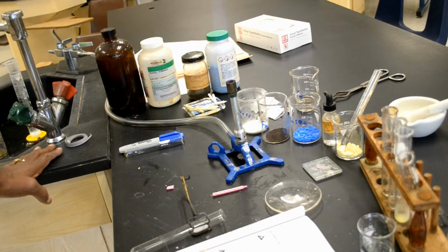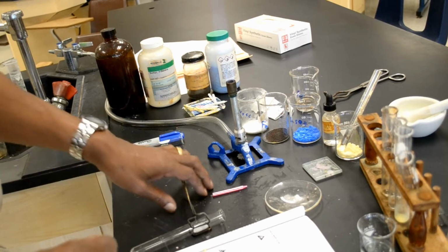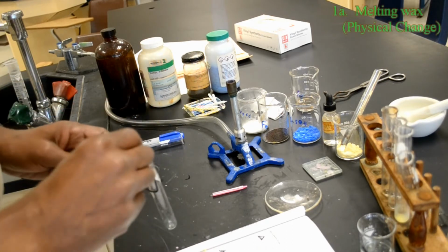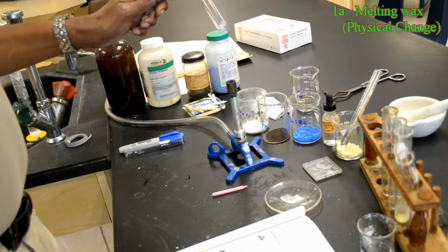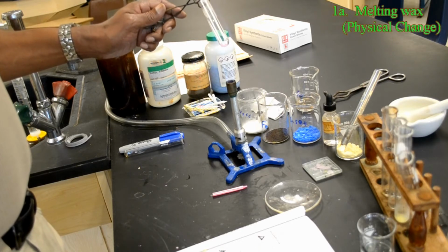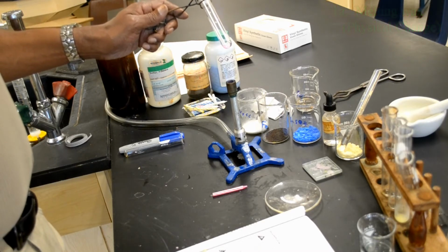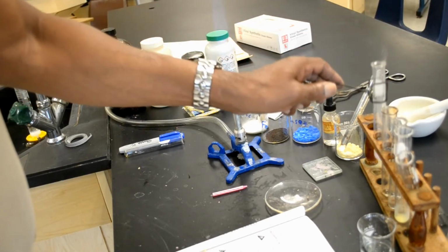Now for the procedure. Note and record all observations in your data table. Place a small amount of wax from a birthday candle into a test tube. Heat gently over a burner flame until the wax melts completely. Allow the sample to cool.